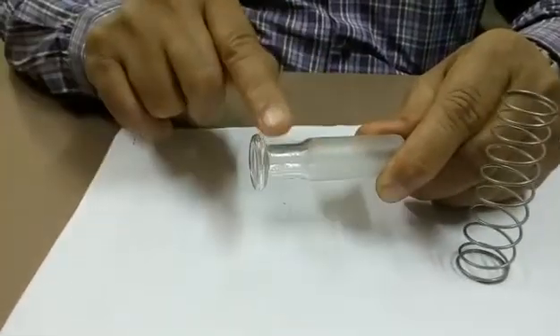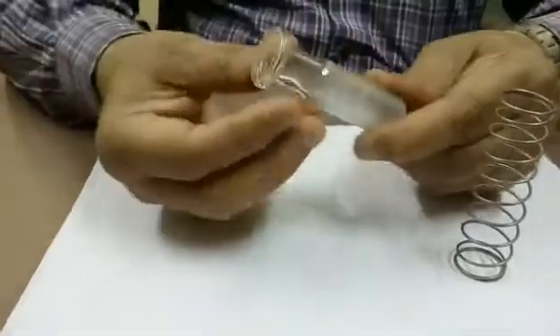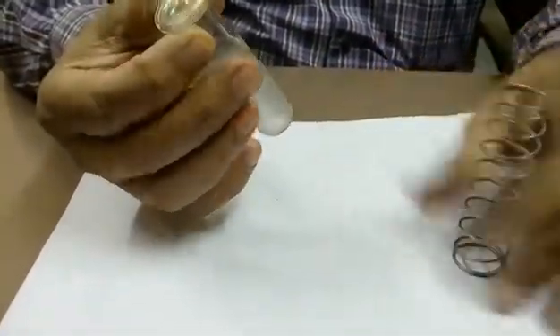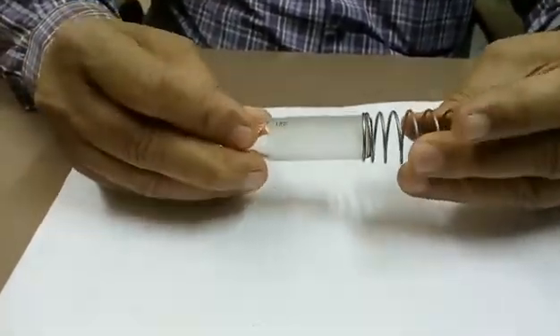Body diameter is bigger and neck diameter is smaller. This end has to hold the neck, that's why the diameter is smaller. Now to insert this, you have to rotate the spring clockwise and push it.